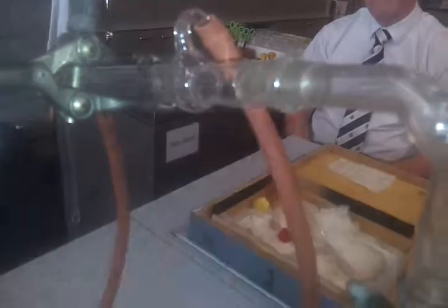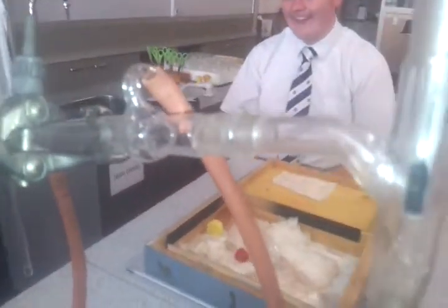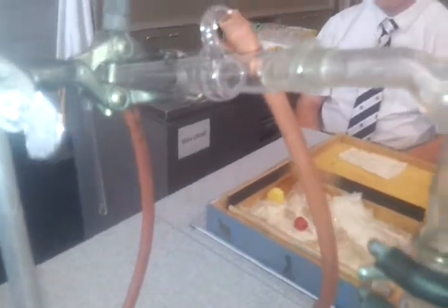Looking at this here, if you've got vapour, the vapour can only escape this way here. So the temperature here is hot enough that you can have it reacting, but not so hot that the ethanol is all a vapour, then that vapour would come down into the condenser. What we have coming in here is going to be cold water. It's connected to the cold water tap. Sorry, I got that the wrong way. Coming in here will be the cold water at the bottom.